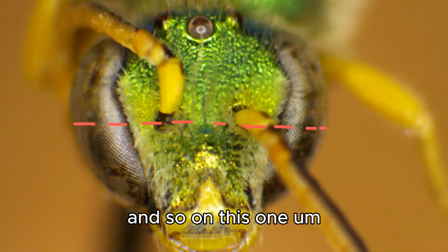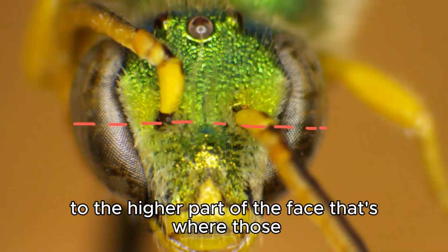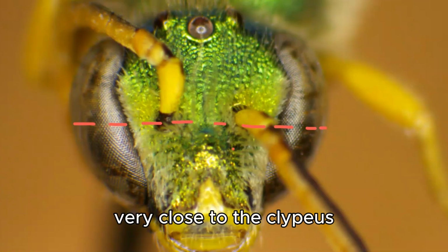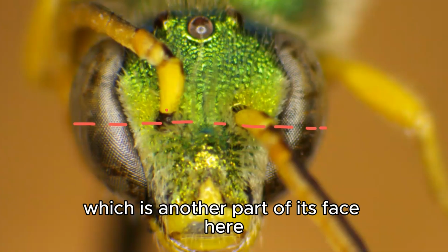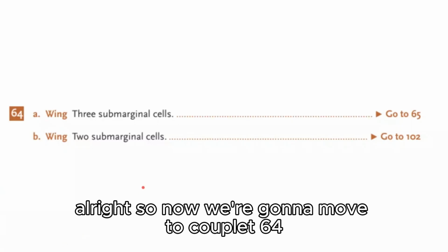And so on this one, it kind of looks more in the middle area, but that's going to be middle to the higher part of the face. That's where those antennal sockets are located. If it was lower, it would be very evident and very close to the clypeus, which is another part of its face here. But this one's going to be kind of mid to high. All right, so now we're going to move to couplet 64.